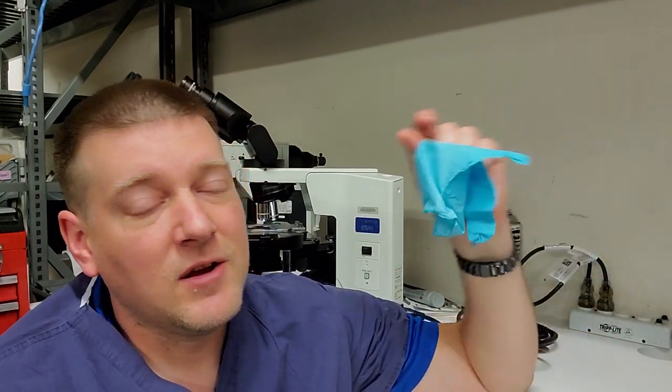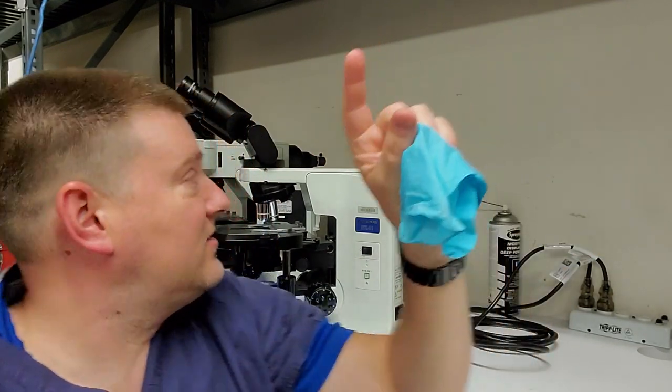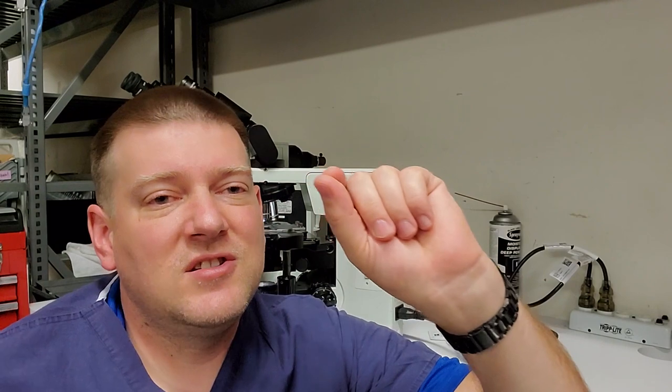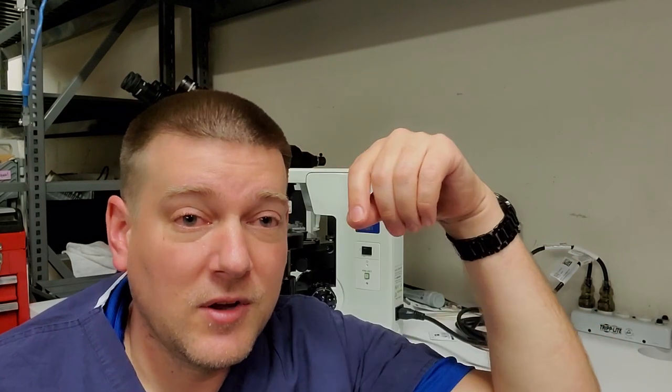The number one thing, guys, you have to have clean hands. Do not touch the glass on any of these. Like, don't put your finger up here, don't put your finger down here. Don't touch the glass with your bare hands. The oils that are on your skin will contaminate the glass, and you will get a rainbow effect when you look through it.